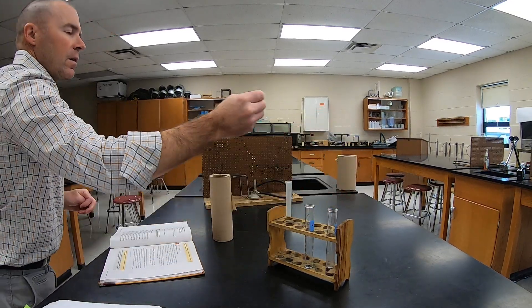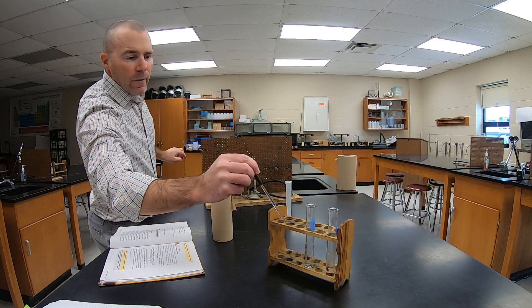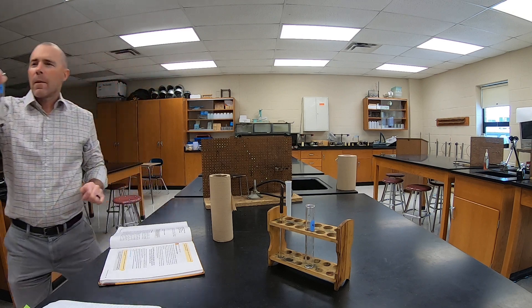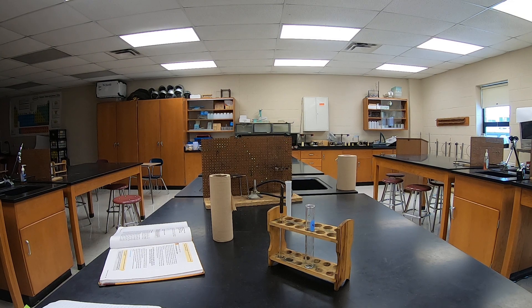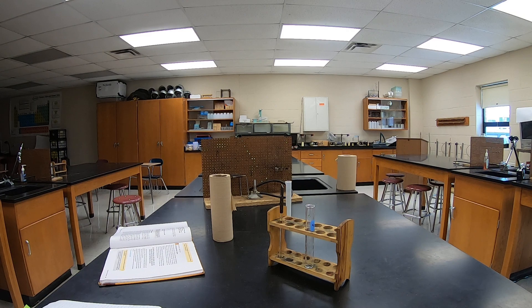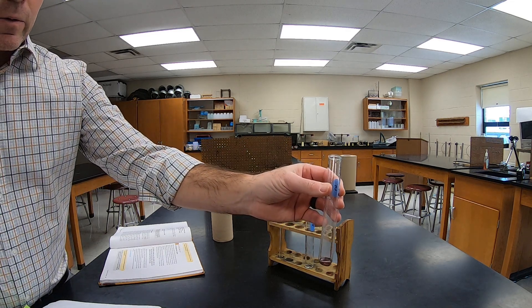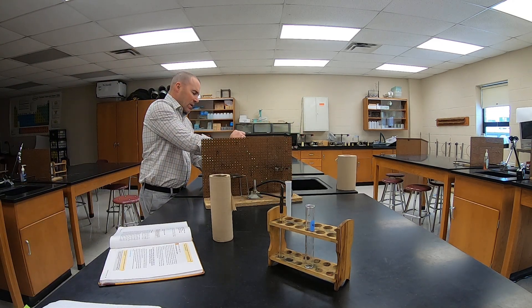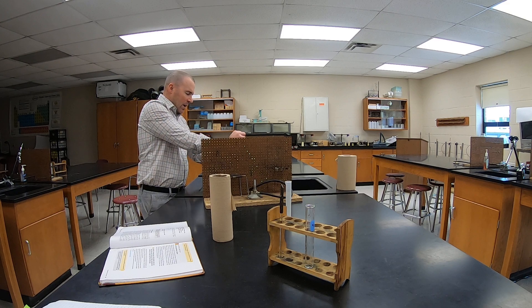Take the stirring rod out since it has hydrochloric acid on it and rinse it off. We'll pour the liquid into a chemical waste container, and we're going to take the stuff left at the bottom and rinse it five times again to get rid of all that hydrochloric acid.